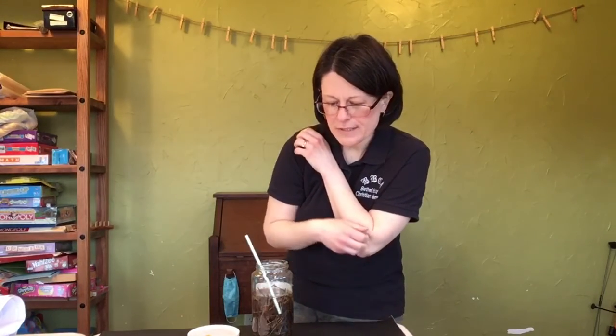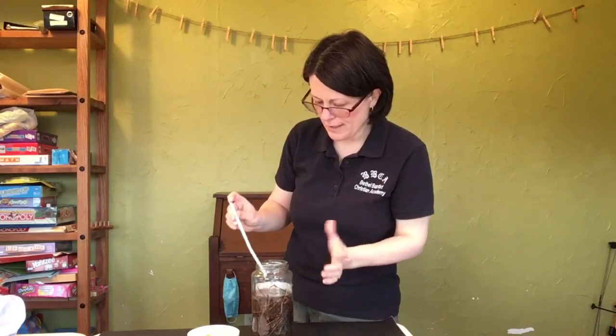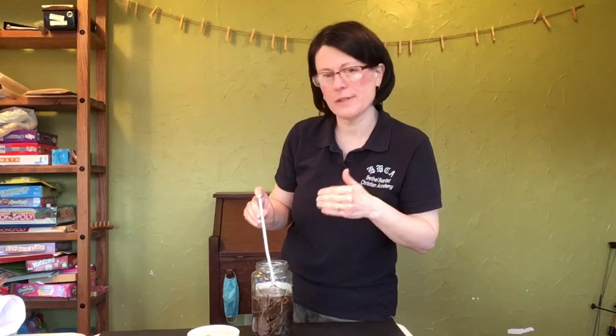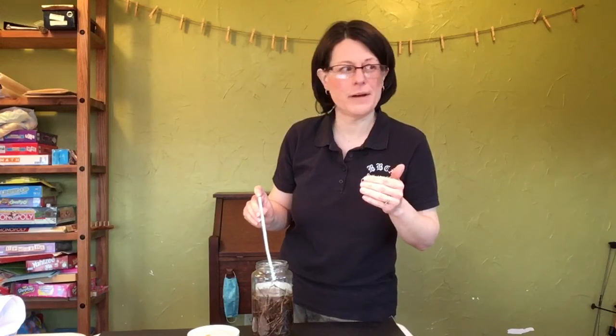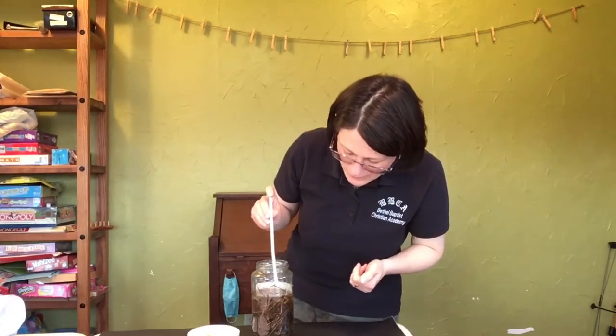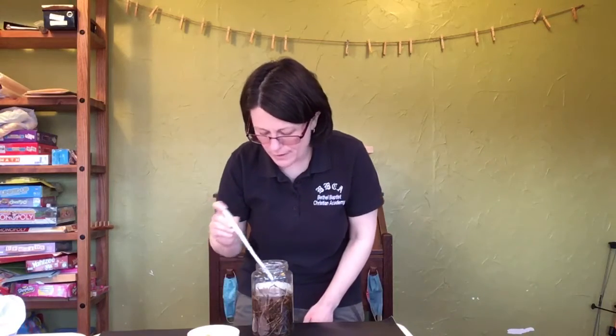To take samples I have my straw — you have your pipette. Reuse the pipettes I gave you. Once you add your pollutant to one jar, try not to mix the pipettes up — maybe mark one somehow so you know which goes in the pollutant jar and which goes in the control jar. Otherwise you could introduce the pollutant into the control jar, and that would not be good. I'm going to take a couple drops of water from the top and put them on my lid.